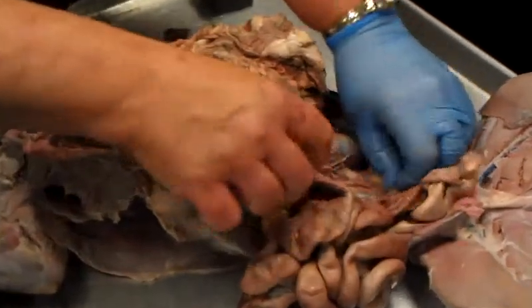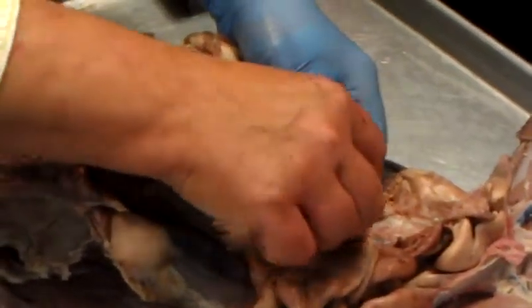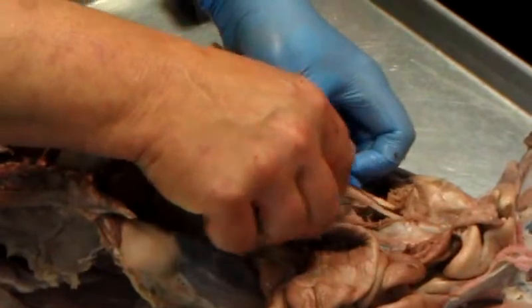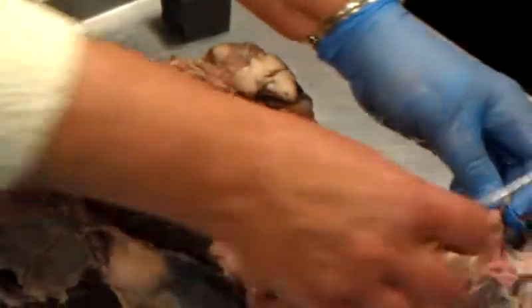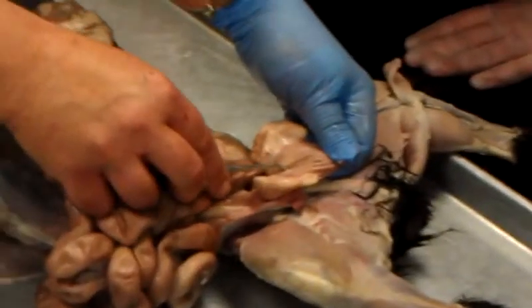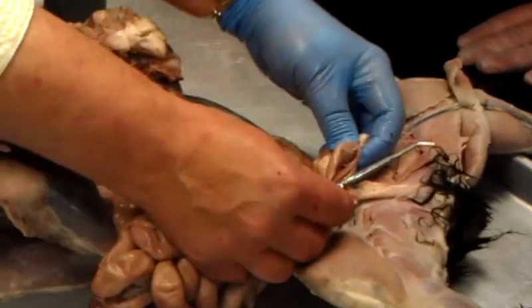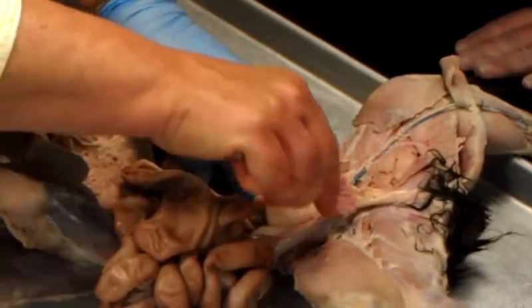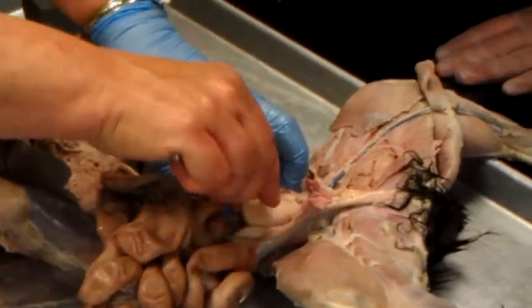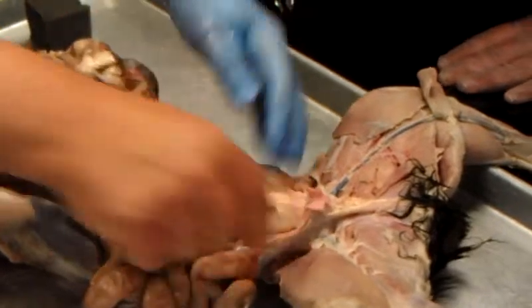Now what do I want to see? I want to find the ureter. Remember the tube that goes from the kidney to the bladder? I'm not going to do it all for them, but this would be the what? Ureter. You should do it on both sides. Follow it down. Here is the urinary what? Bladder. Guess what I would do with these two pieces of fat? Take them, cut them out. Then coming off the bladder, when you clean this up, that's the urethra.